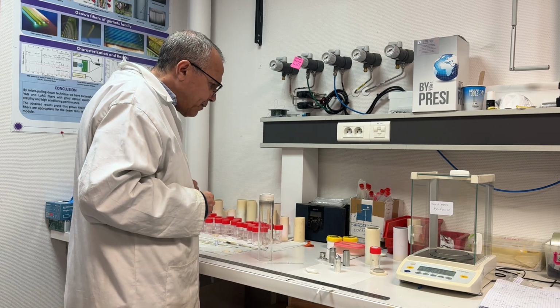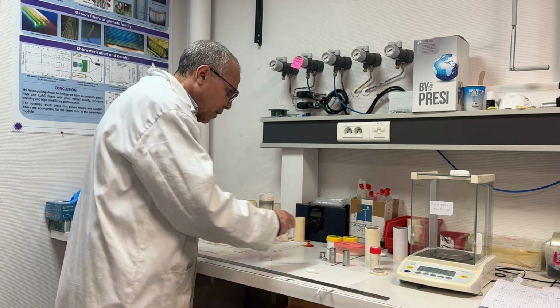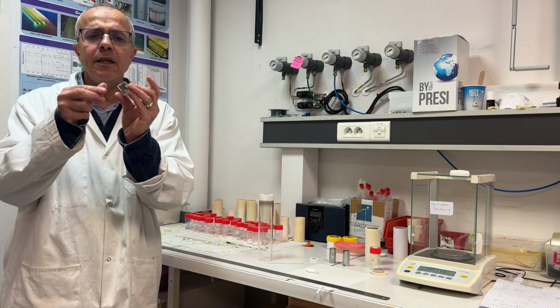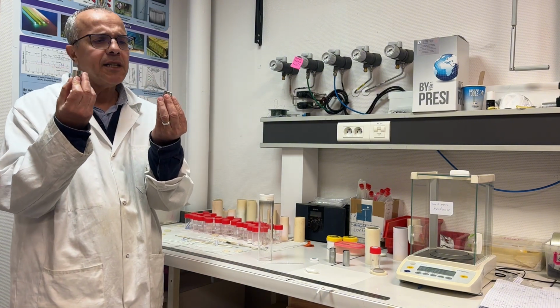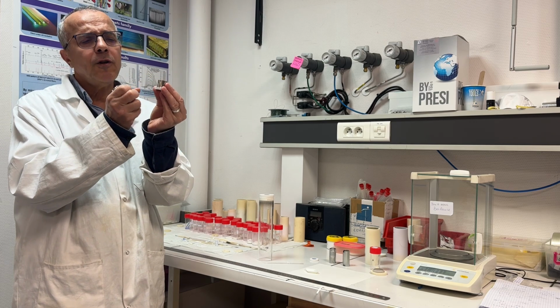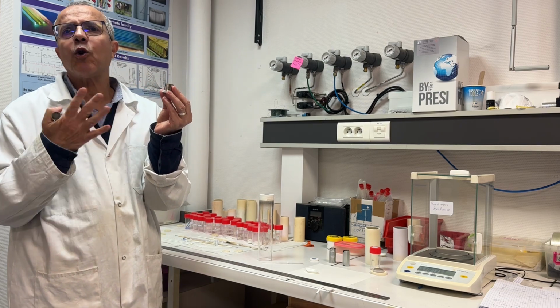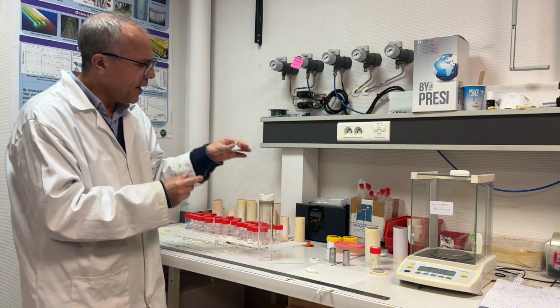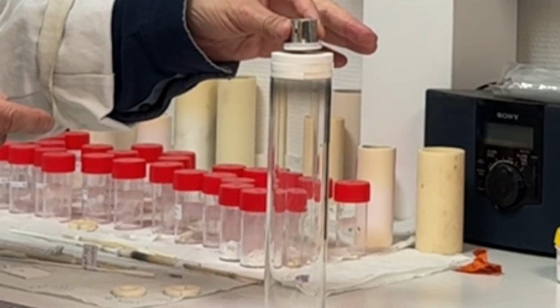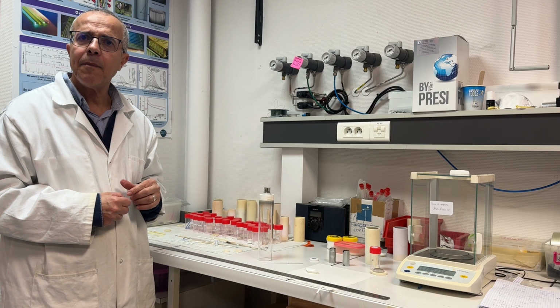Then I have to use an after heater. This, for example, is what we will use to grow GAGG crystal. It is an after heater with a hole. The after heater allows us to control the thermal gradient well. We put the after heater here. We have to take care, slowly, step by step.